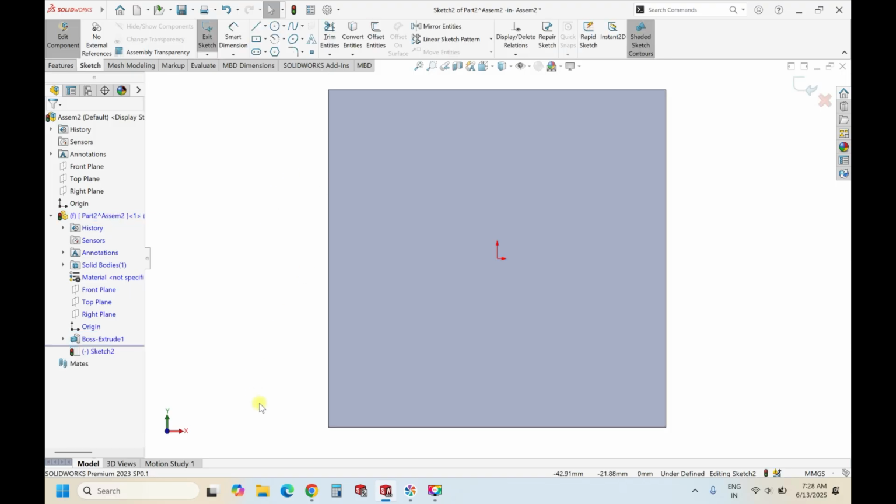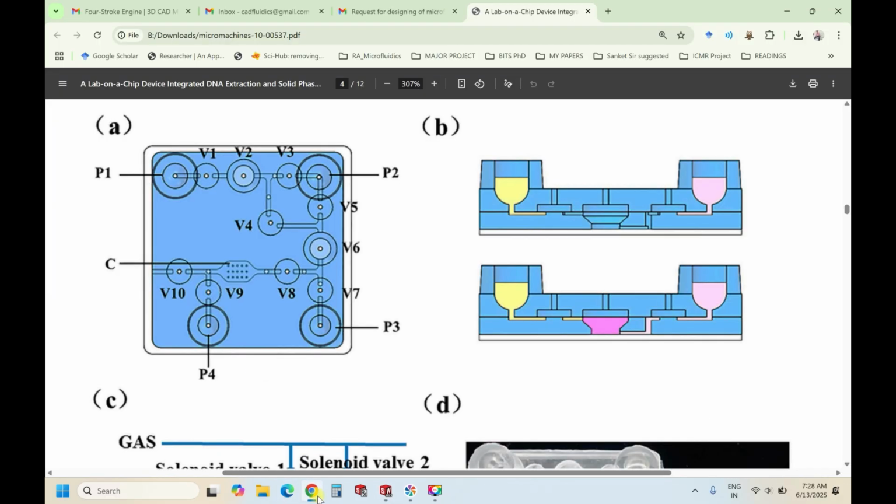Okay, so now let's start with the designing of this. First we have this circle, and then this circle, and then this circle. So there is a continuous array of circles connected with the microchannels. Randomly we have 1, 2, 3, 4, 5. So basically P1 and P2 are at the ends, and then this is in the middle. So we can make V1, V2, V3 in the middle.